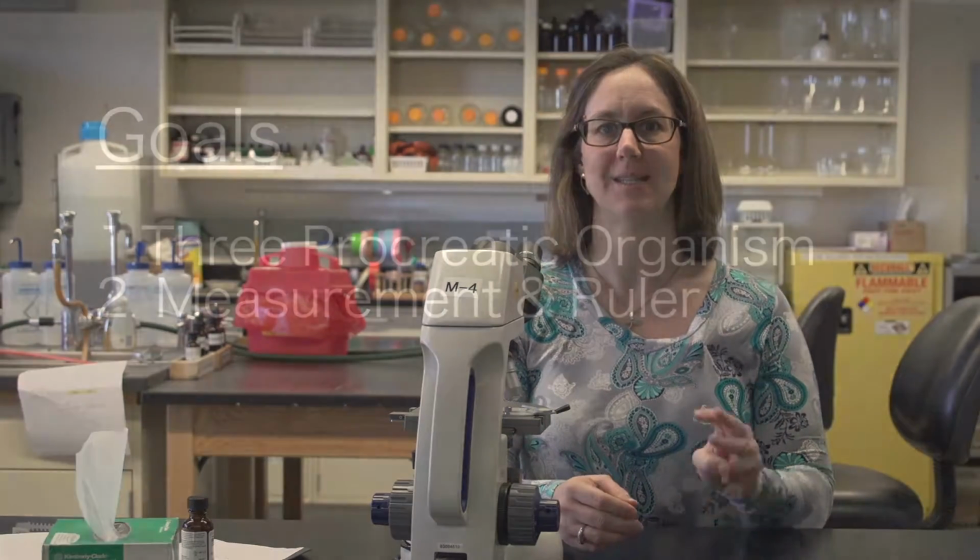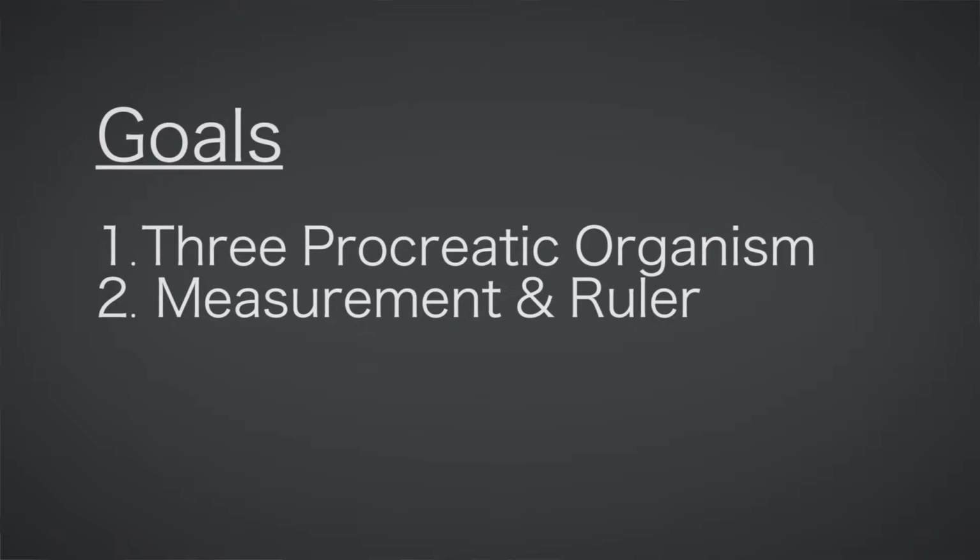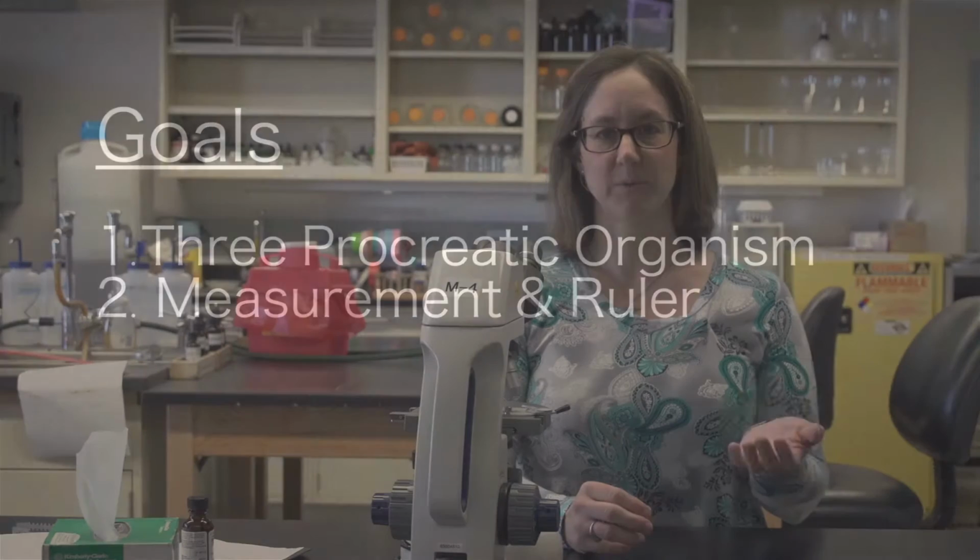The second day of laboratory with exercise 2, we have people look at prokaryotic organisms. And the overall goal of the exercise is to have 3 drawings of prokaryotic organisms, all with the measurement and the ruler drawn into the notebook. With prokaryotes, which are much, much smaller, you need to have better resolution in the scope. To have good resolution, we have to have the light coming into the lenses of the microscope.